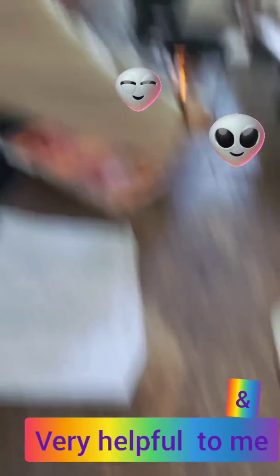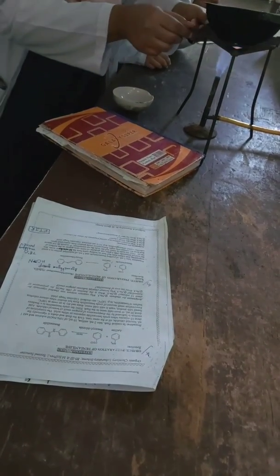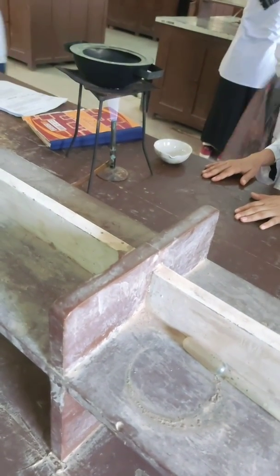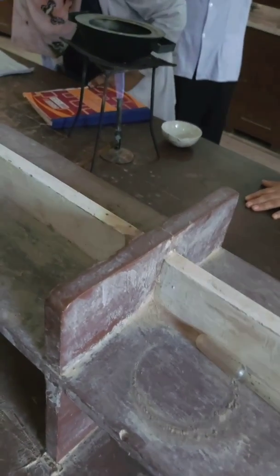Mr. Irfan is there — he's my lab assistant, a very senior lab assistant, and he's very helpful. He's helping them as I've guided them on how to do it. The flame is on now. The girls are doing some mixing in the fume hood as well. Now they are doing the process — you can see the reaction going on. They are now preparing the water bath, and as the water starts boiling they are going to start the reaction.